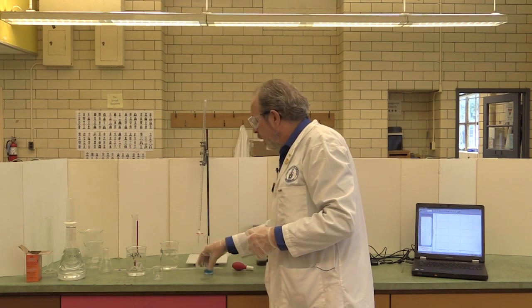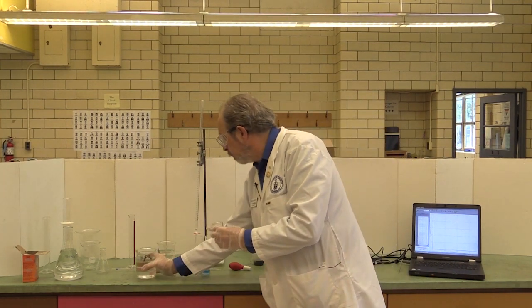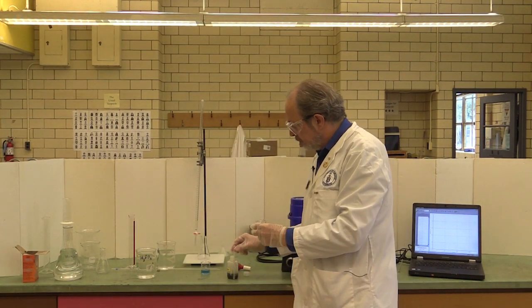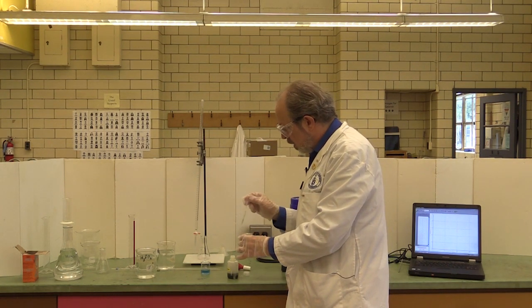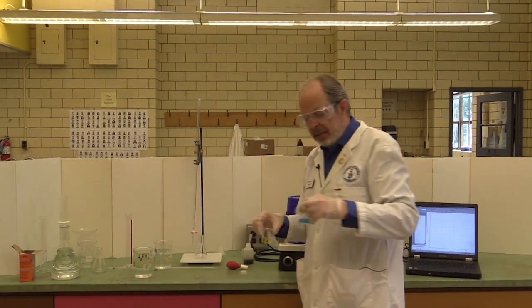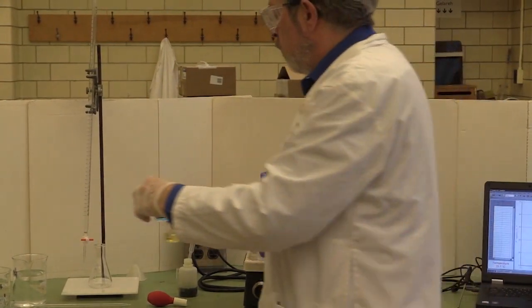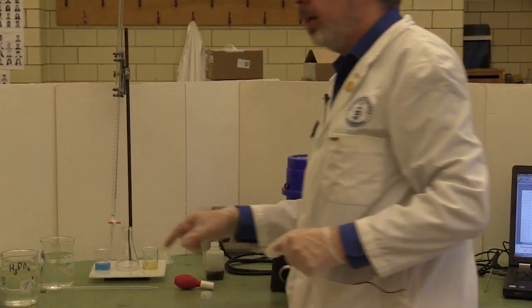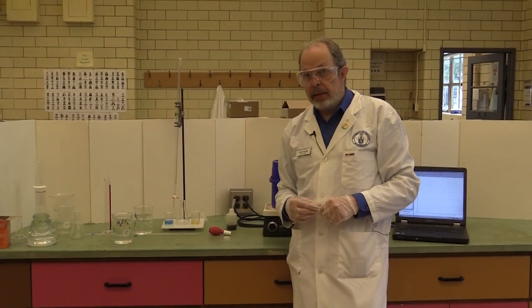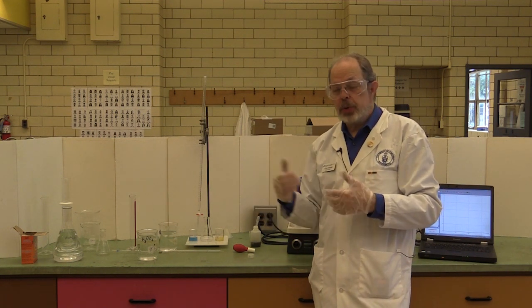You really need to make color comparisons here. So take a small sample in a beaker of your acid and add some of the indicator. And in this case, that will go yellow. Take a sample of base and add indicator and that goes blue. Put these on the white titration background on either side of the titration vessel. The end point is the green that comes halfway between the blue and the yellow.